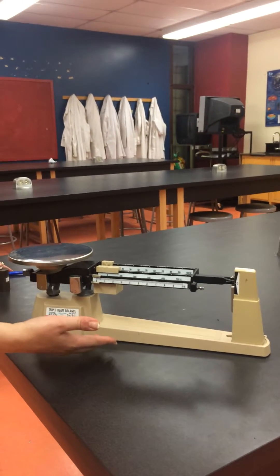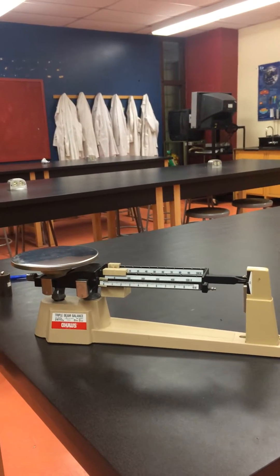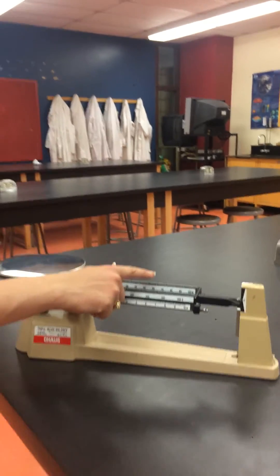So here we have our triple beam balance. It is called a triple beam balance because it has three beams: one, two, three.